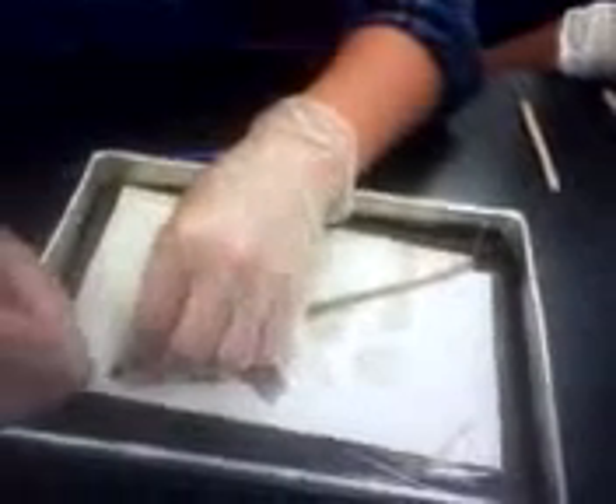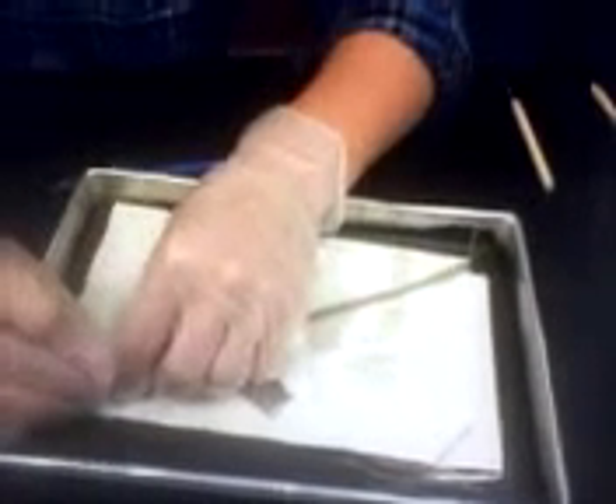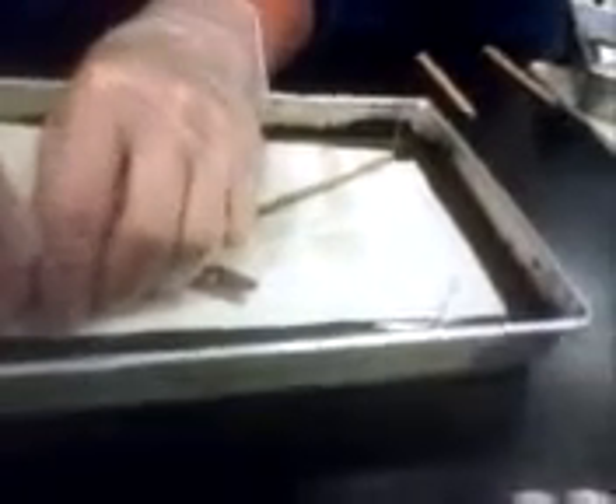Put it at the end. Pull it all the way through. And then stretch it. Stretch it all the way from end to end. It looks so gross.